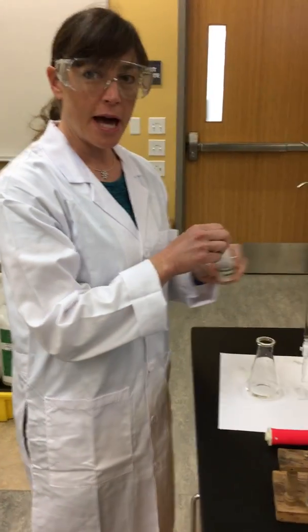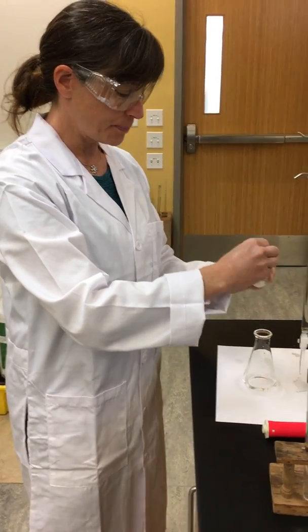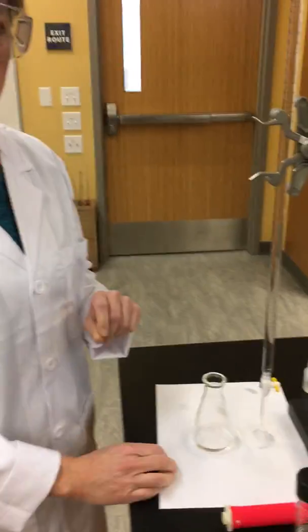We're now going to add our phenolphthalein indicator, and we're now ready to do our titration.